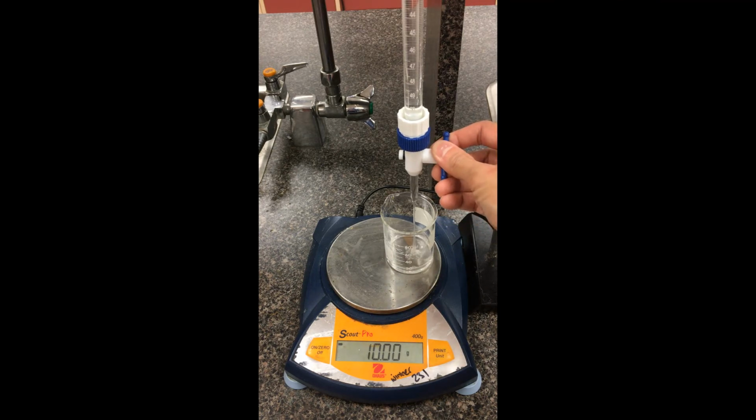Going down to the 12, we're there, okay. So 12.04, a mass of 13. Going down to 15, remember this is saltwater solution here, that's 15.20. You can record down that as a mass here. Going down to 18, so it's 18.10. You can record down that as a mass.